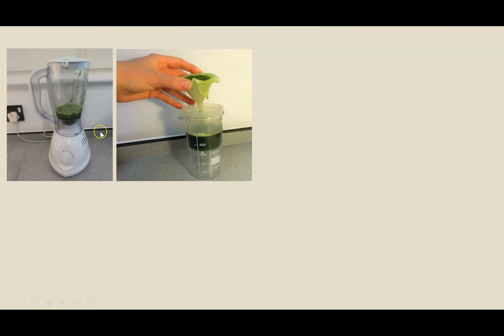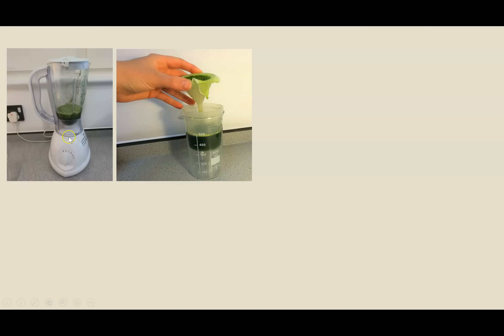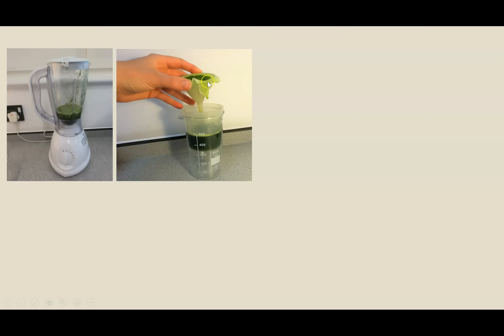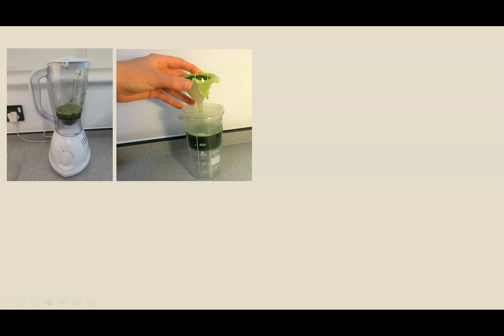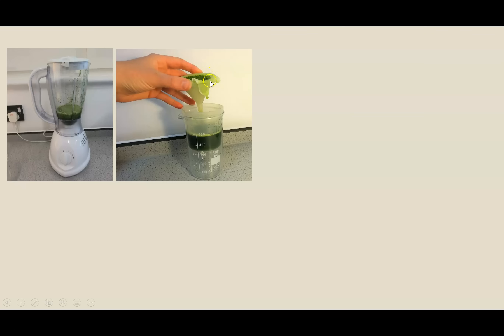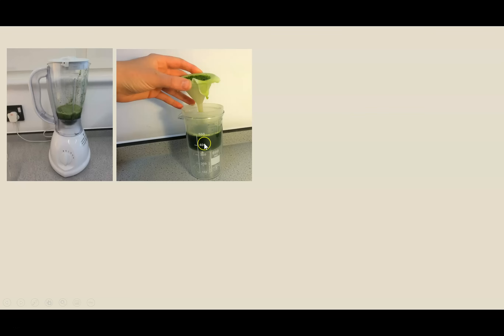To show how I got the chloroplast suspension: to homogenize or blend and break open the cells, I used spinach leaves and an ice-cold isolation medium containing salts to make it isotonic. Once I've homogenized and blended for no more than 15 seconds, I then filter through a muslin cloth. This filtering stage is to remove large debris — large cell debris and other organelles — so we just get the isolation medium and the chloroplasts.